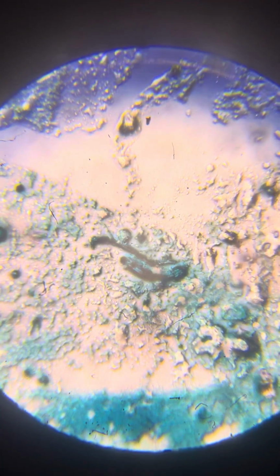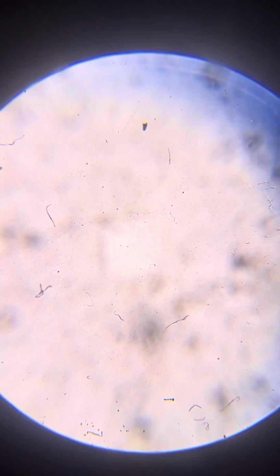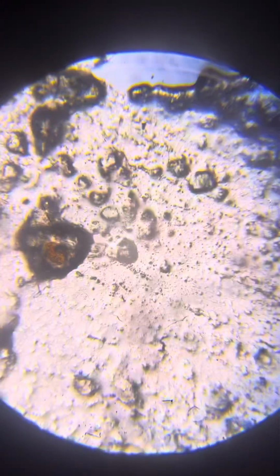So the yeast, they were pretty much gone. We don't see much of it, even though I've added quite a bit of yeast now. Maybe they ate it? I don't know. Question. Okay, I've added quite a bit of this yeast. Maybe I added a little more even, in the next slide. Mostly these are gone. Maybe just eaten. I don't know. Nice life form, not sure what it is.